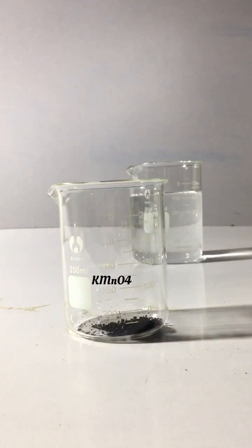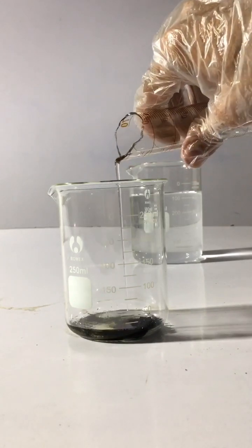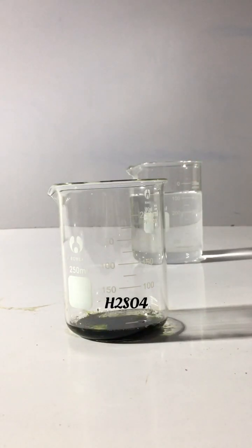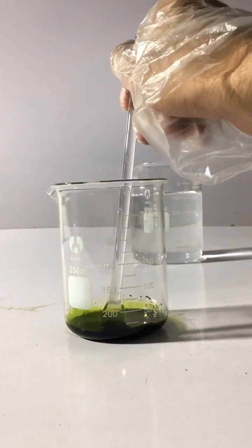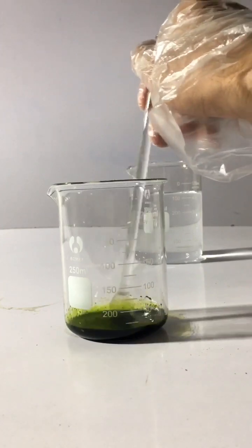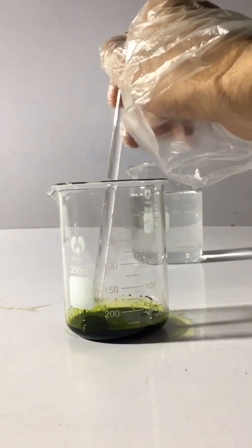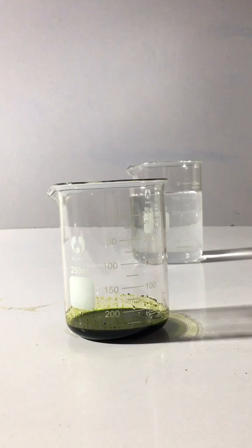The next step is to add sulfuric acid to it to dissolve it. You can see a greenish color forms - a strong oxidizing agent. After the addition of a few drops of ethanol, you will see a fire.